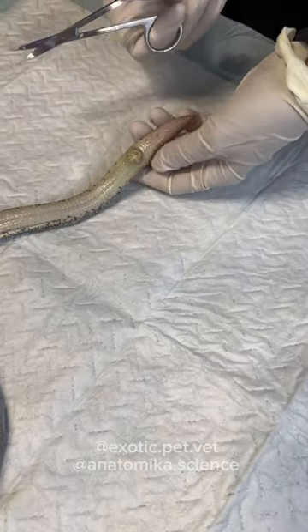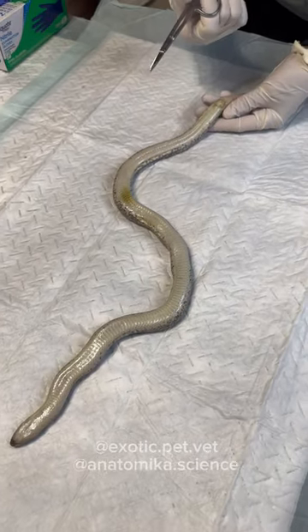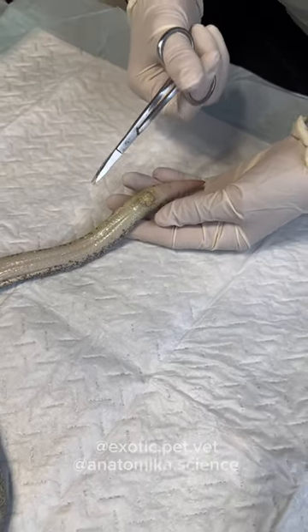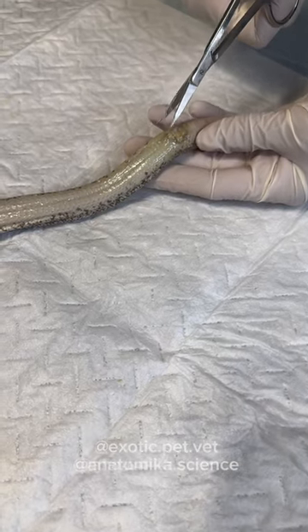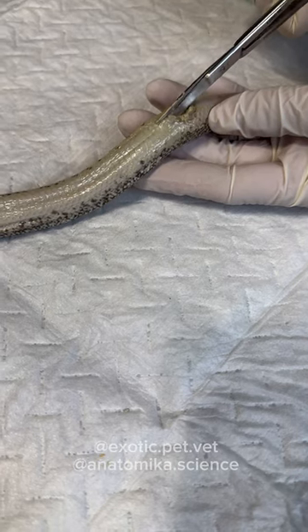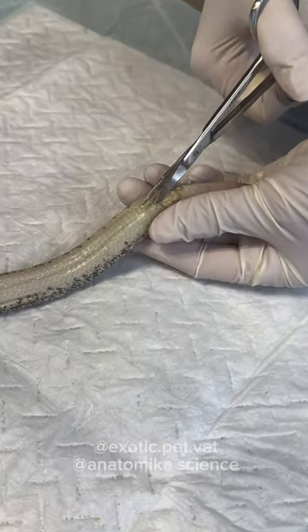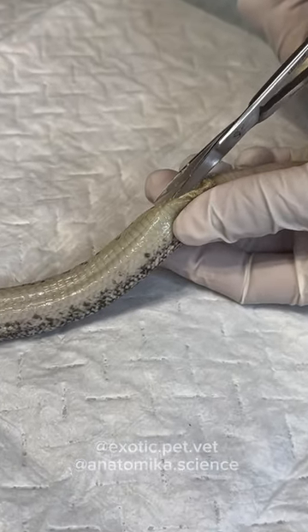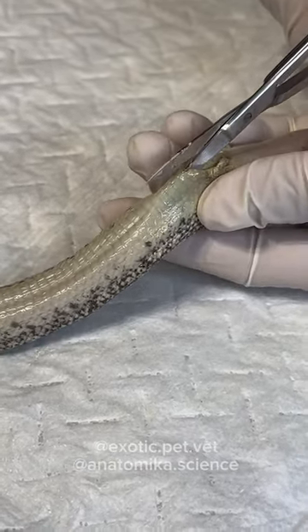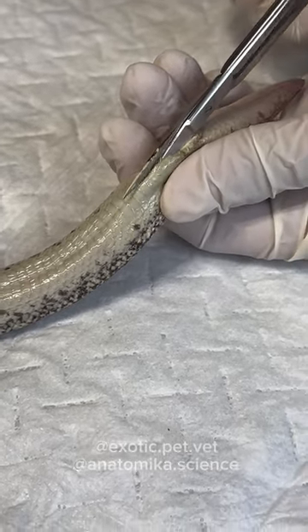So from a breeder's perspective, when cutting in for necropsies, you want to use small, sharp scissors. These are dissection scissors, but I also like cuticle and nail scissors — they work very well and you can get them at Walmart for a couple of dollars. Start at the vent, make a small cut, and the really important thing is to poke your scissors in horizontally, not down, and then lift. That way when you poke it in and lift, it pulls the skin away from the organs so you're not making a large cut along the organs.